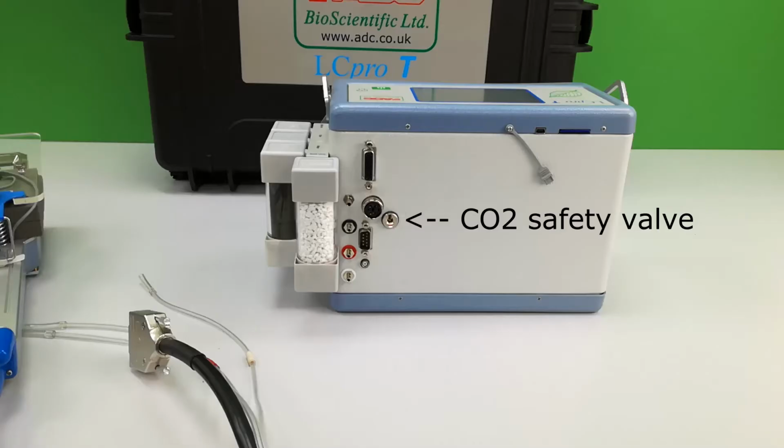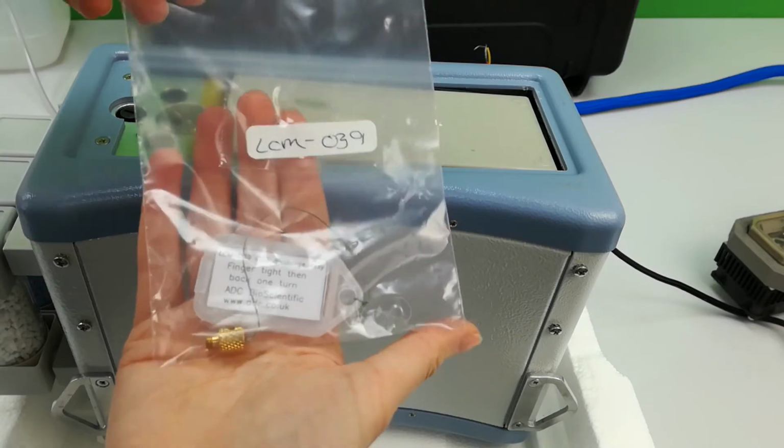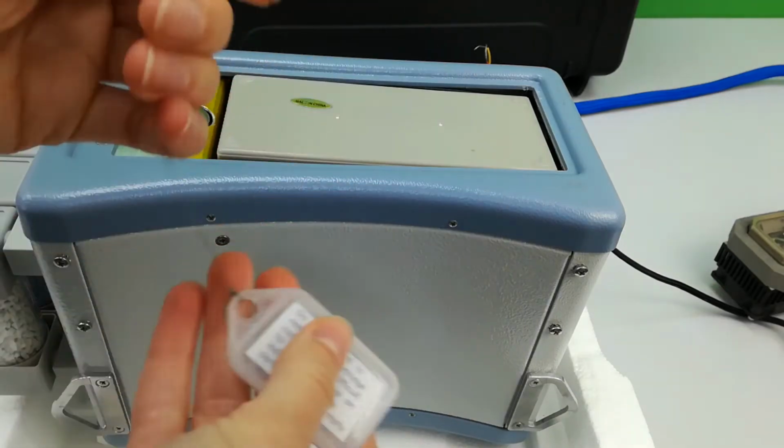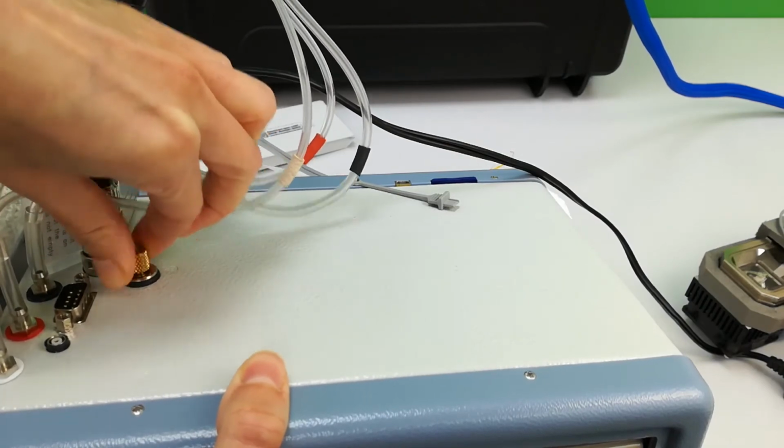Alternatively, if you know that a filled CO2 cartridge is installed and you wish to swap the cartridge, use tool LCM039 and screw this fully into the valve and then back for one turn. Leave the tool in place in the valve for 30 minutes.